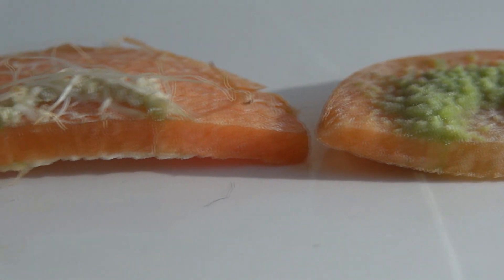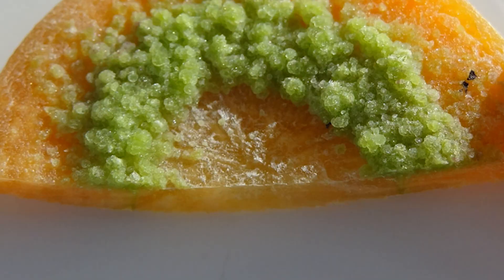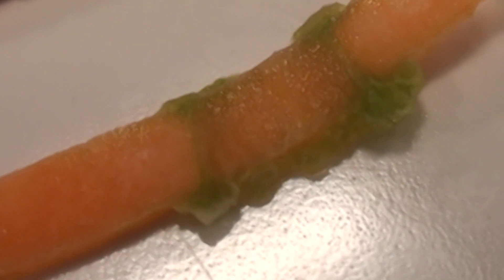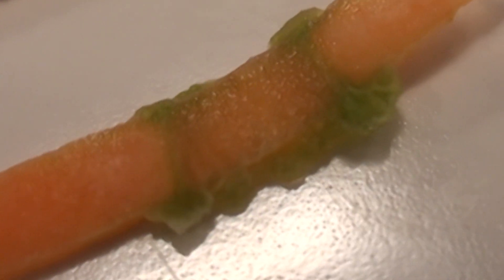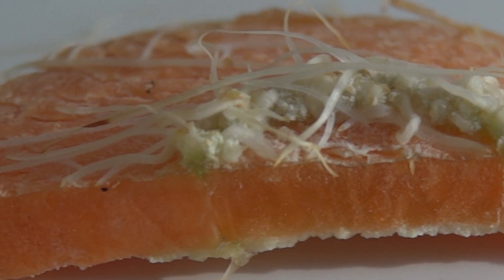The growth is coming from the region between the cortex and the stele, where the cells have been activated by the hormones present in the bacterial plasmid to produce the differentiation of the cells.